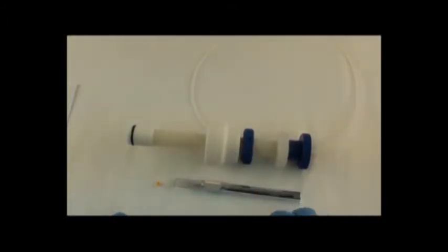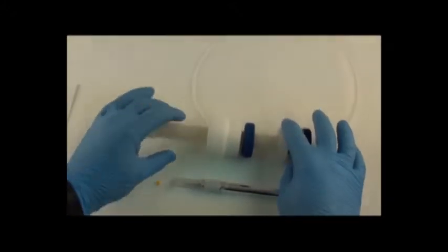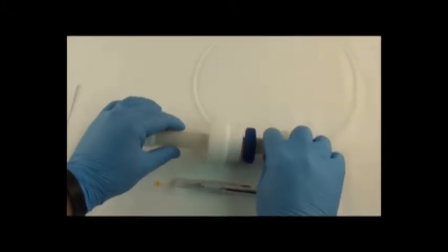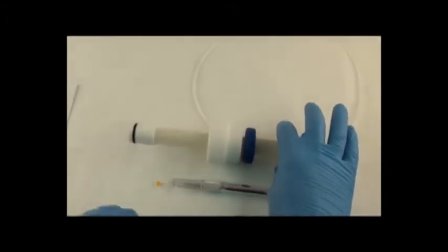So let me talk about the parts of the flow adapter first. There's a top knob, there's a knob clamp, and the knob clamp has a set screw in it and it's attached to this threaded rod so it doesn't turn independently, it turns the entire threaded rod.